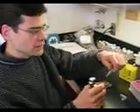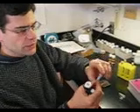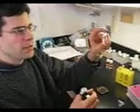We're going to prepare a sample for mass spectrometry, and the first thing we did was prepare matrix, 10 milligrams per milliliter inside this vial.